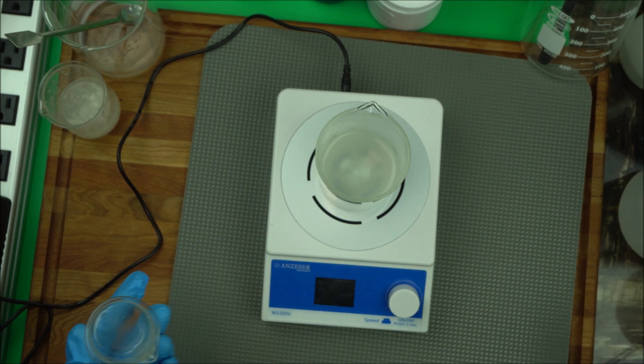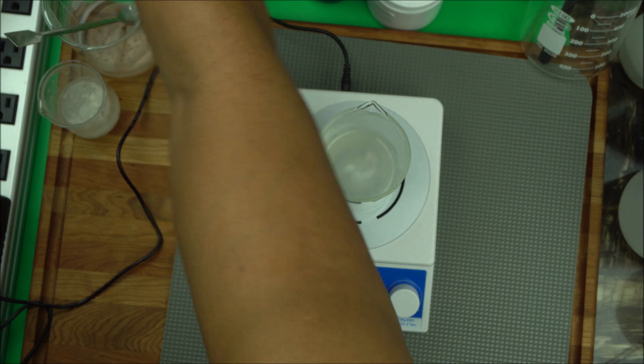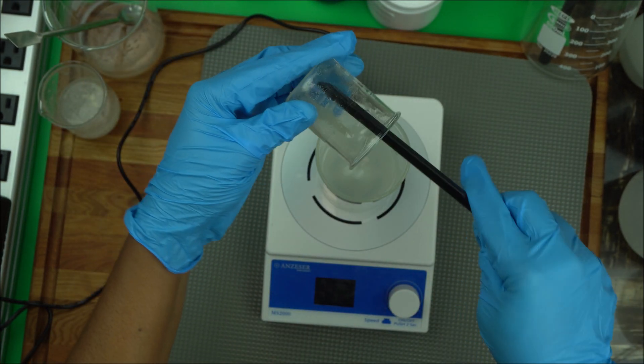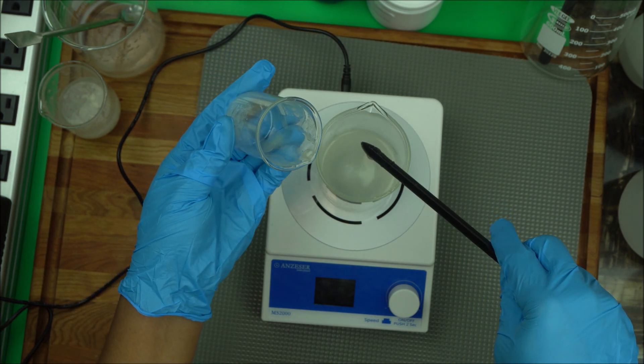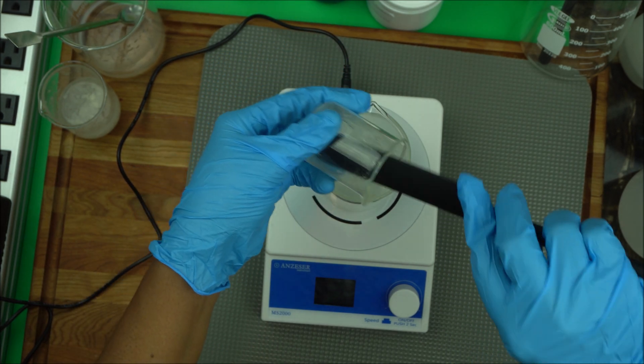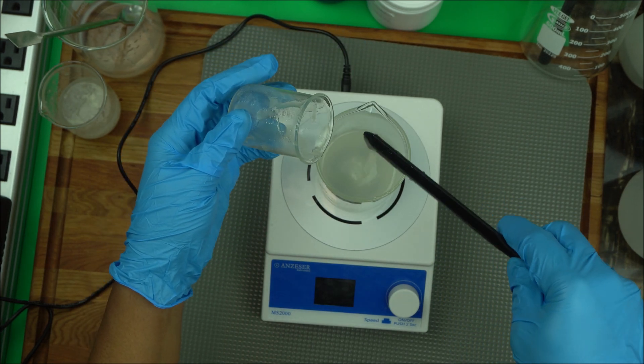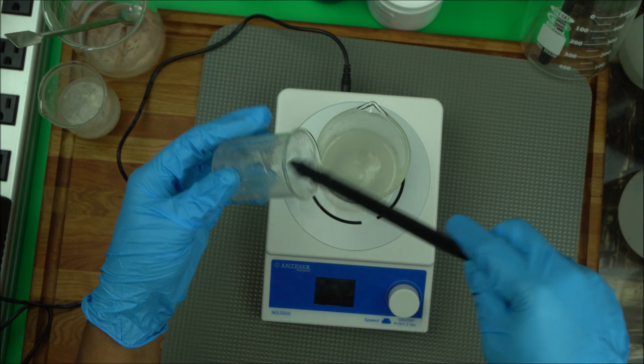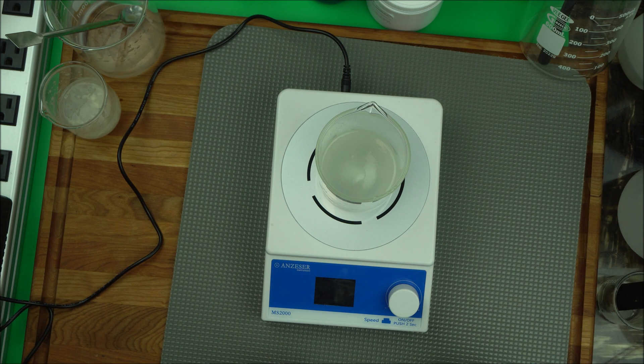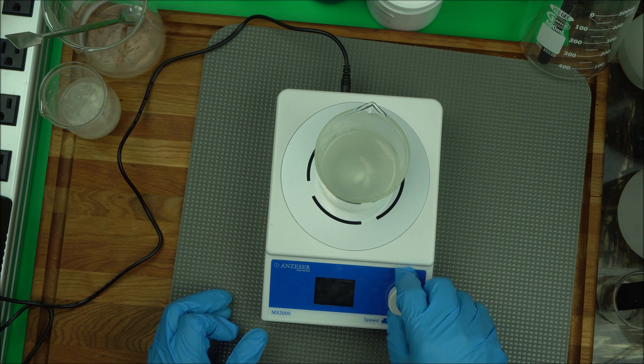Don't forget what I'm doing now. Your spatula will do a better job for you to move this down. Once you have done that, we're going to improve the rpm. You want a stronger vortex. We want to let the rpm be 1700.